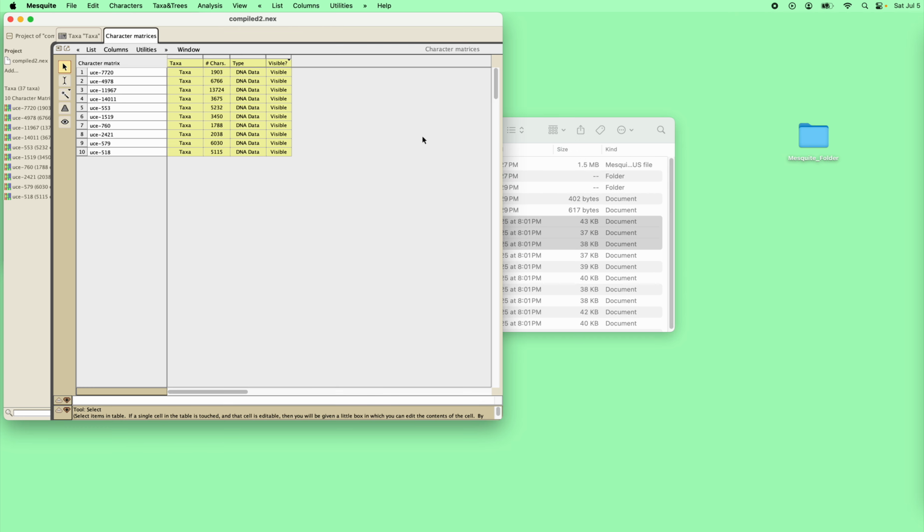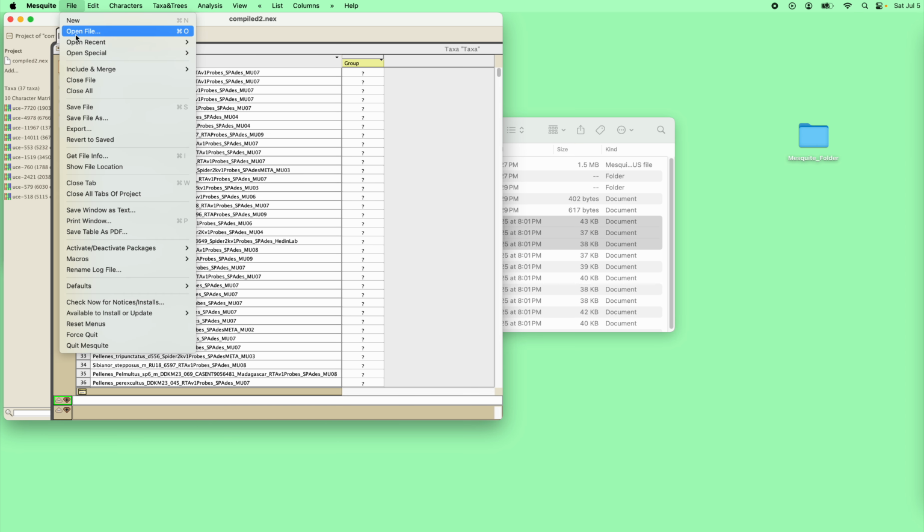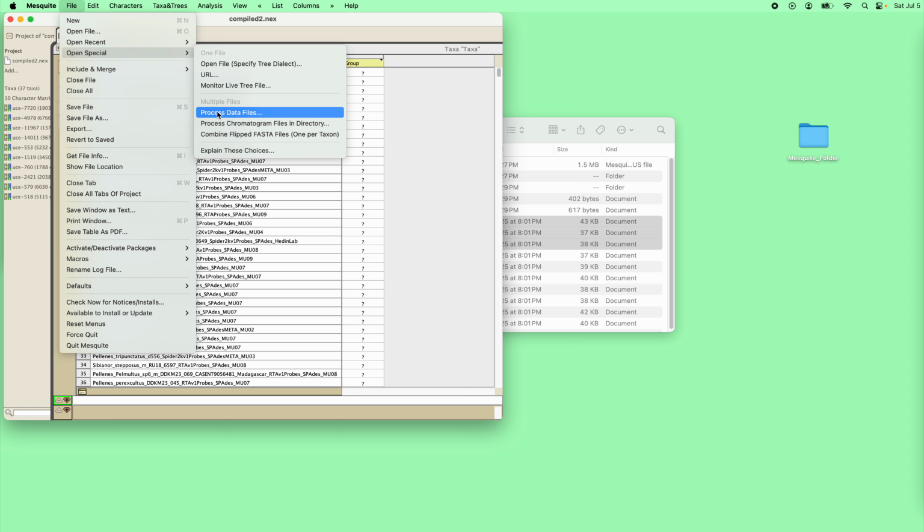Of course, these are different taxa sets, as you would have seen. And now it works. We got rid of the UCE names as we went. There's a lot more to be said about the process data files, but that's for another day.